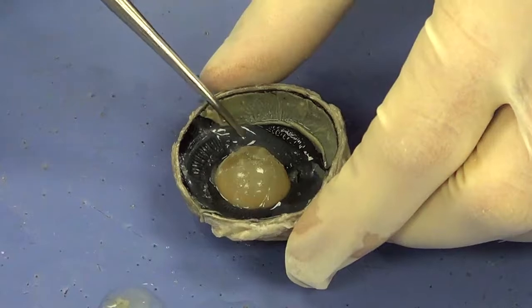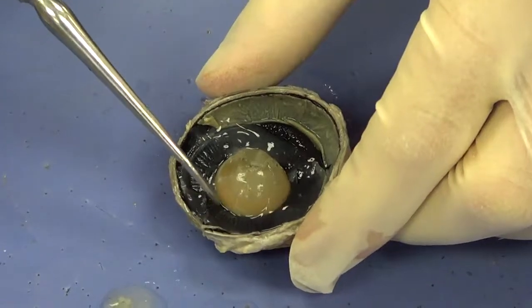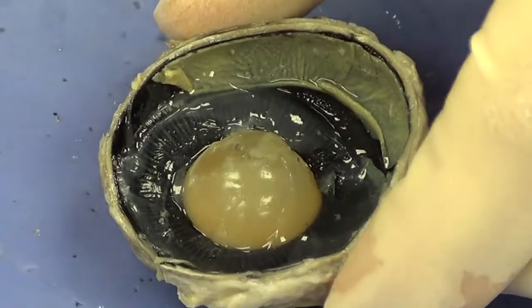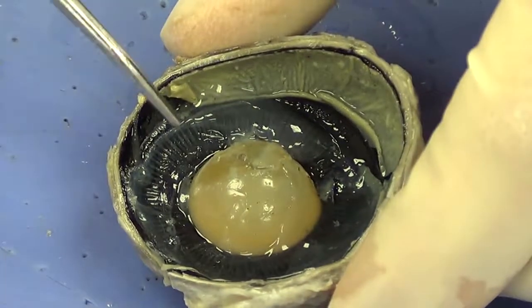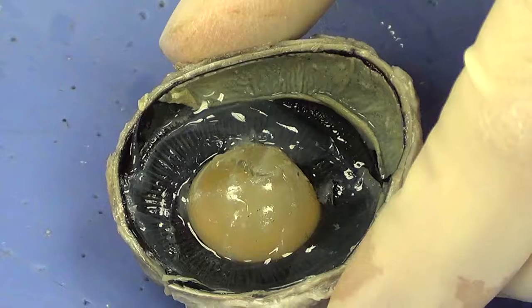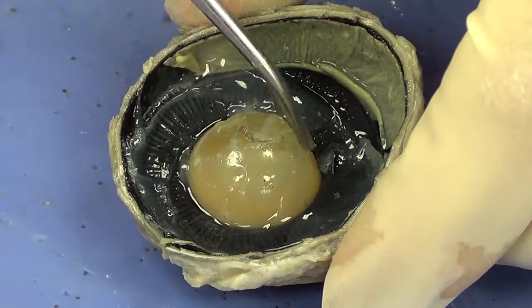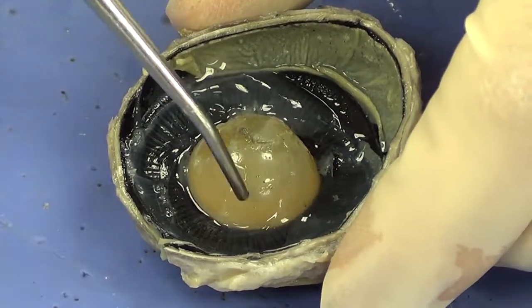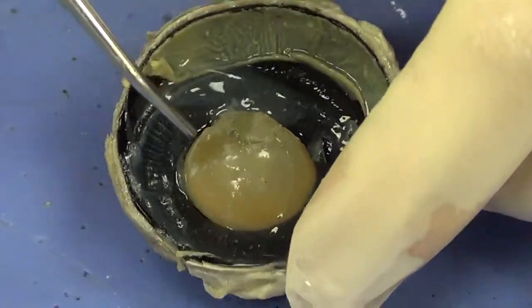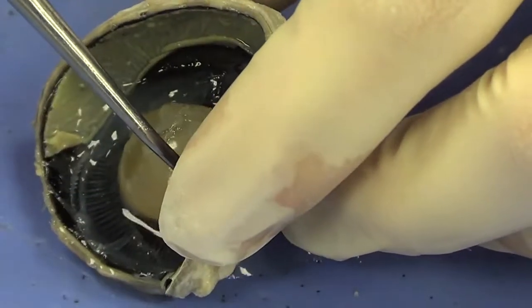Now let's take a look at this black structure that surrounds the lens. You can see all these striations. That is called the ciliary body. It is actually attached to the lens, and that ciliary body is going to be responsible for changing the shape of the lens. If we look close or if we look far away, that ciliary body is going to contract accordingly and change the shape, either flatten the lens out or make it more spherical like it is right now. I'm going to slowly remove the lens, and as I do, we're going to see if we can see where the ciliary muscle is actually attached to the lens.